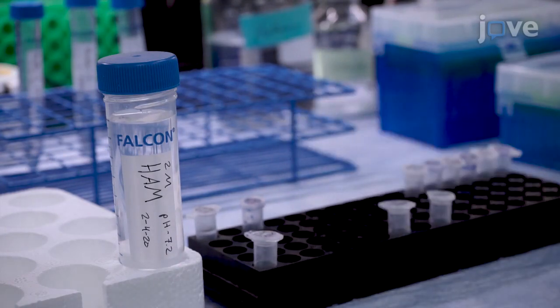Visual demonstration of this method is critical for steps like chloroform methanol precipitation. The pancake-shaped pellet obtained during this step should be handled very carefully. It can be fragile, and partial loss of the sample during this step can lead to uneven sample recovery.